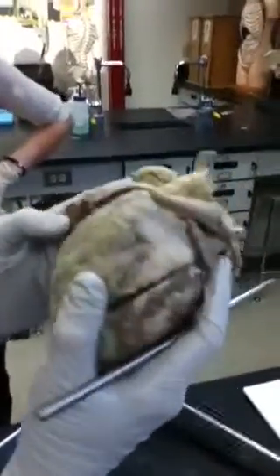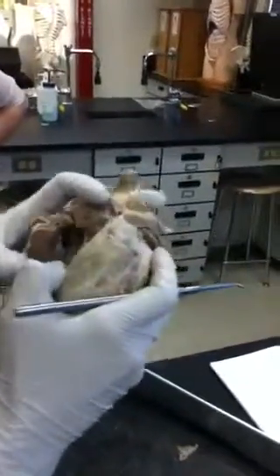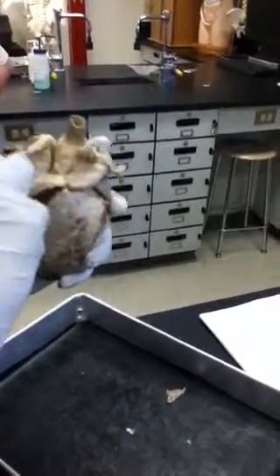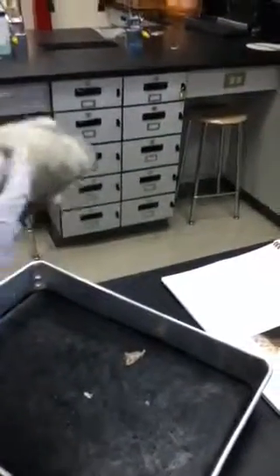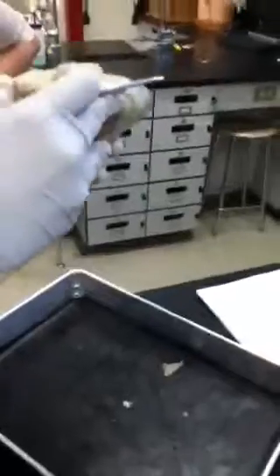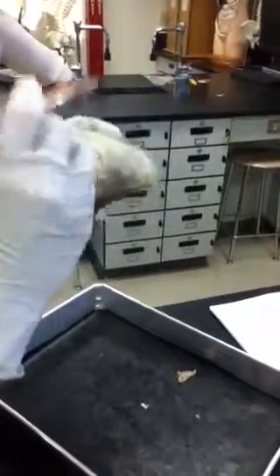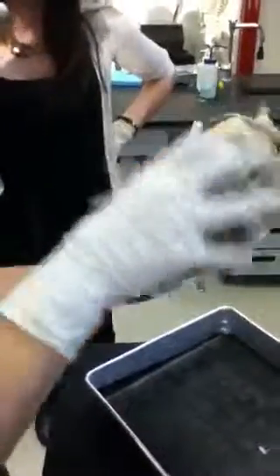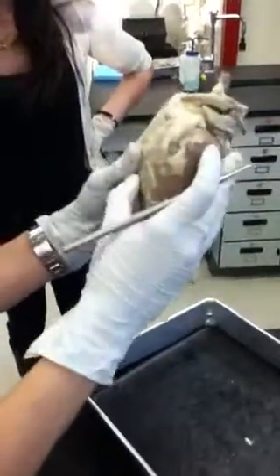The only other one that you have to know, let me see if it's intact, is the moderator muscle, which you probably have intact because it's not cut. You didn't cut far enough down, so I'm not going to tear your heart, so I'm going to flip it around. Right down in here, where is it? Right here is your moderator muscle, and normally you can see it goes all the way across the ventricle. It's thought that, as the heart's contracting and relaxing, it prevents it from over expanding. So it keeps the right ventricle from over expansion.